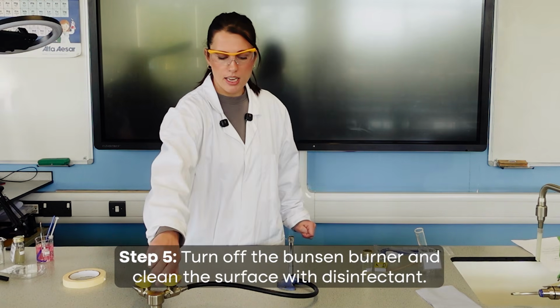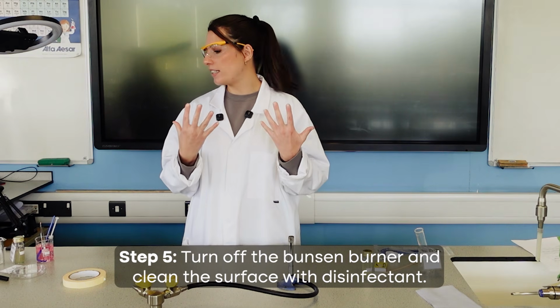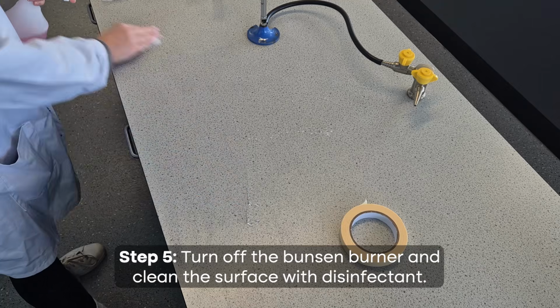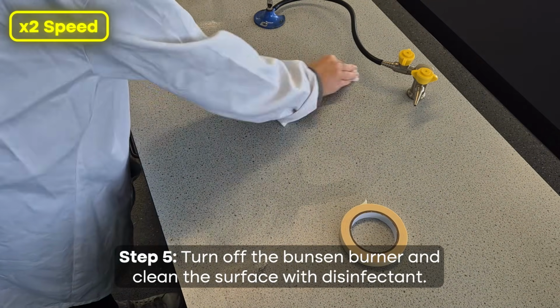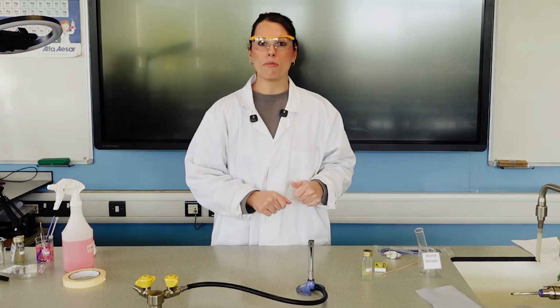So final step, I'm going to turn off the Bunsen burner, and then we need to clean the surface with disinfectant and wash our hands with soap again. So there we go, just clean down the area that I worked. And I've then been washing my hands with soap also.